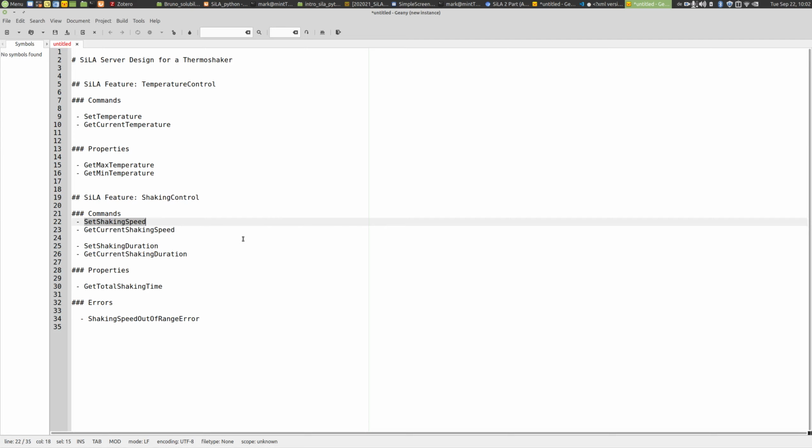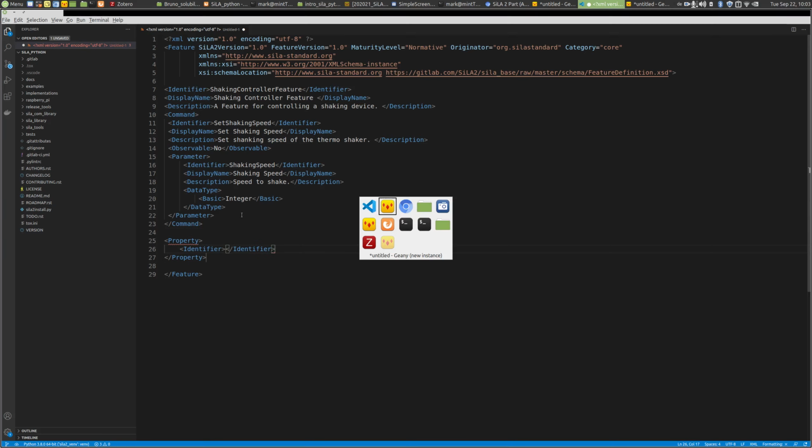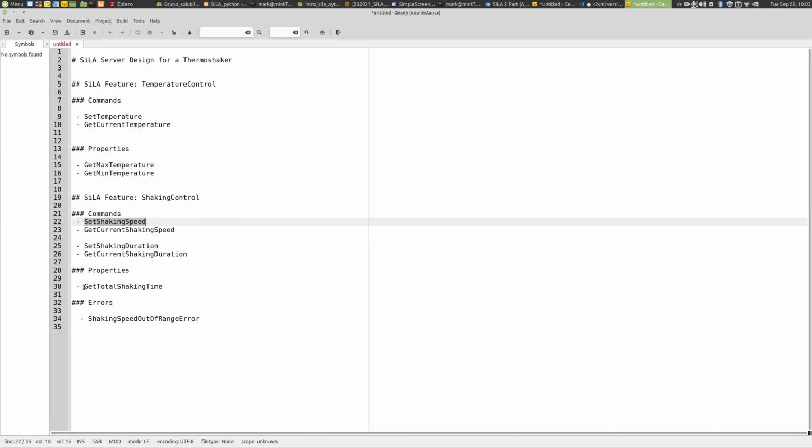I'll skip this for the sake of shortness, and let's just see how properties work. So let's just specify a property. It's very similar. So you have again an identifier here, and we would like to have a get total shaking time property.